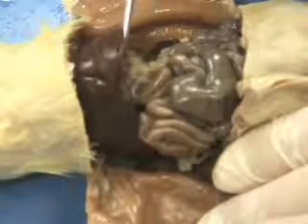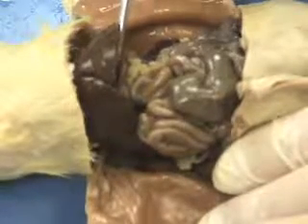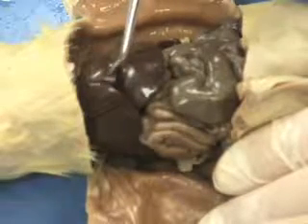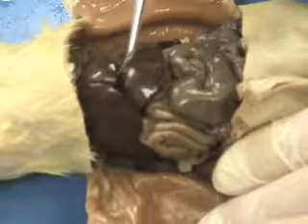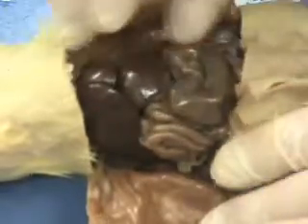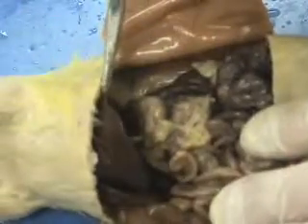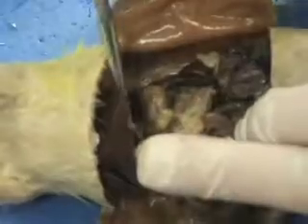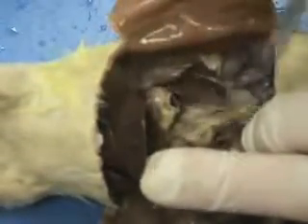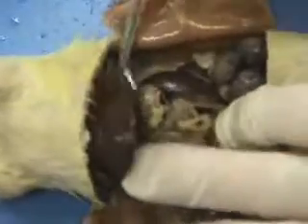With that liver, remember, one of the functions is to produce something to help you digest your food. And for humans, it's stored in a place called the gallbladder. Read your directions on the rat to be able to find out where that gallbladder is. If we move some structures around, we're going to be able to find underneath here that a lot of these organs are connected by this clear tissue. It's really best that we remove some of that tissue away so we can start to really see some of those organs. And right now what I'm trying to isolate is the stomach.